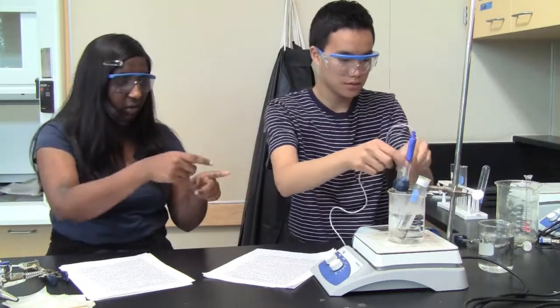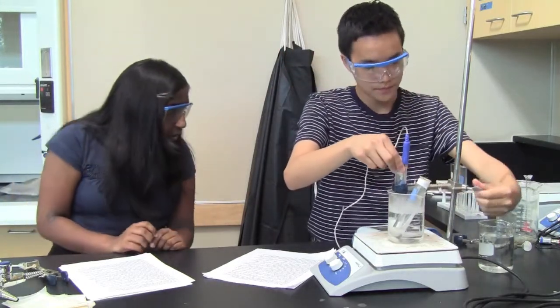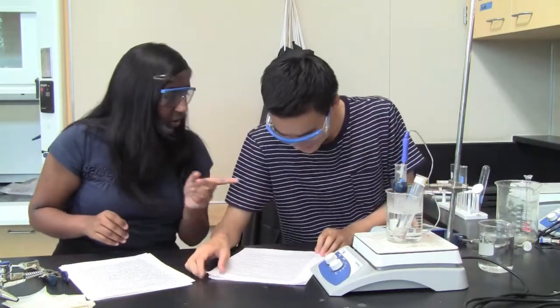Frozen, as you can see. Now we let it sit in there. We can stop collecting data at this point. As you can see, I've stopped the graph. You want to make sure that you correctly have started or stopped the graph.